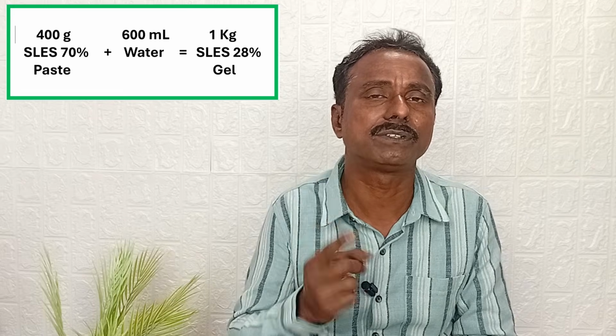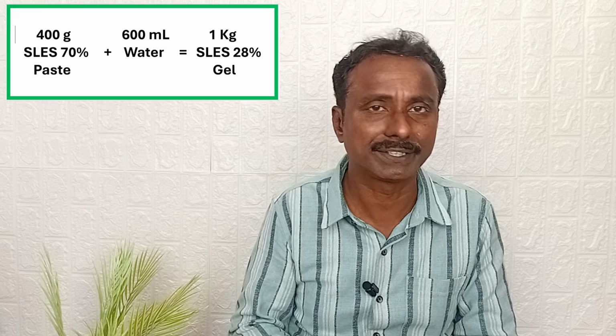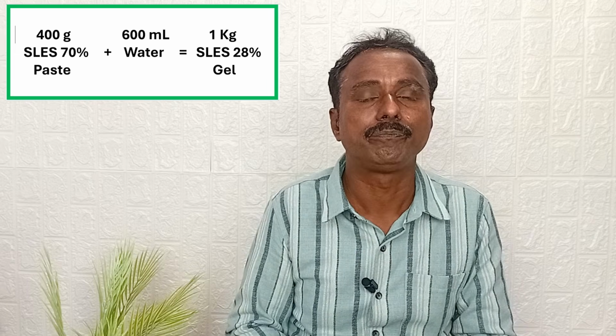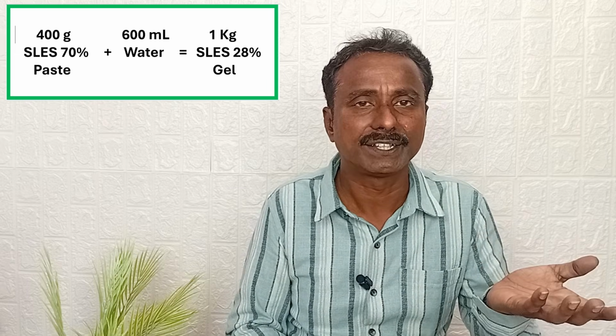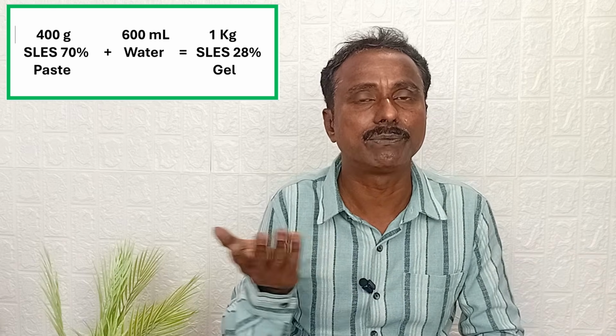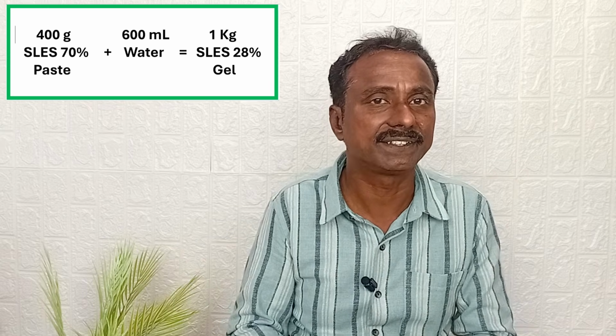There are two steps. First one is calculation, second one is method. We'll discuss. First, the calculation, it is very simple: 400 grams SLES paste plus 600 grams water is equal to 1 kg SLES gel. That's all. This is the calculation.